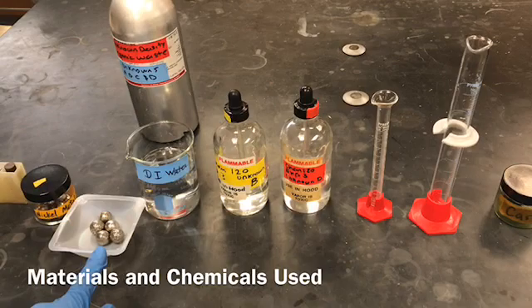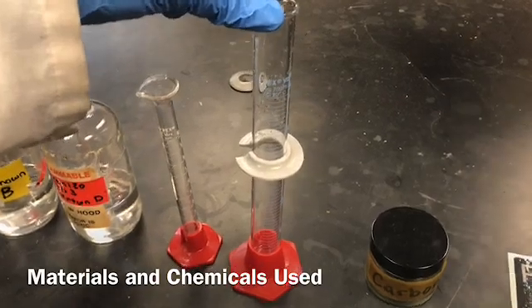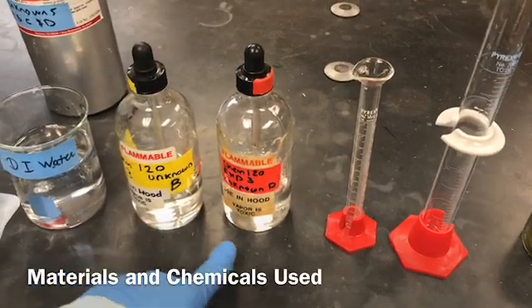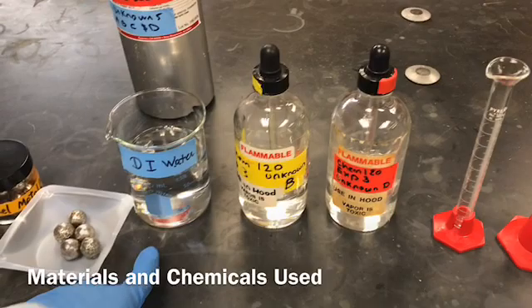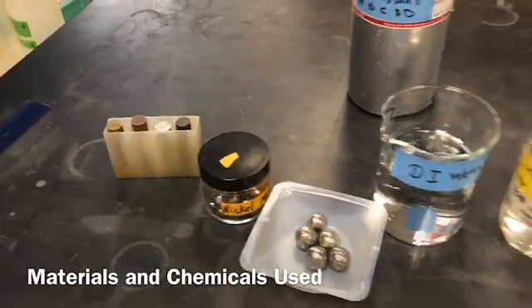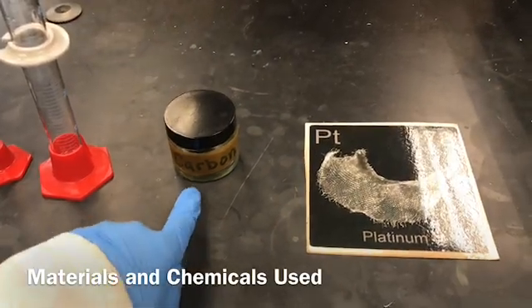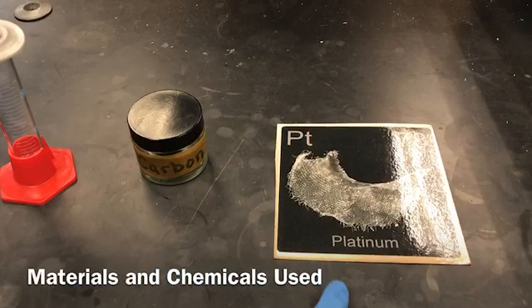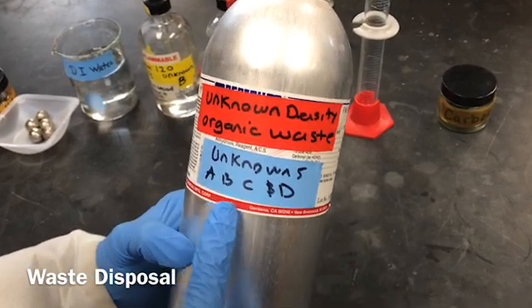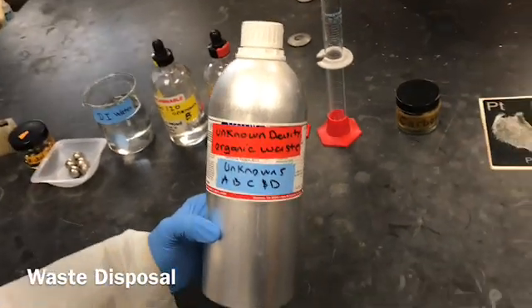Here is what we need to do this experiment: measuring cylinders, 50 milliliter and 10 milliliter; organic liquid unknowns B and D; deionized water; nickel metal; and the metal cylinder. We also need the different elements in glass bottles or card form. We cannot dispose of organic liquids in the sink, so we have a special waste container. This is the container I will use to dispose of my used organic liquids B and D.